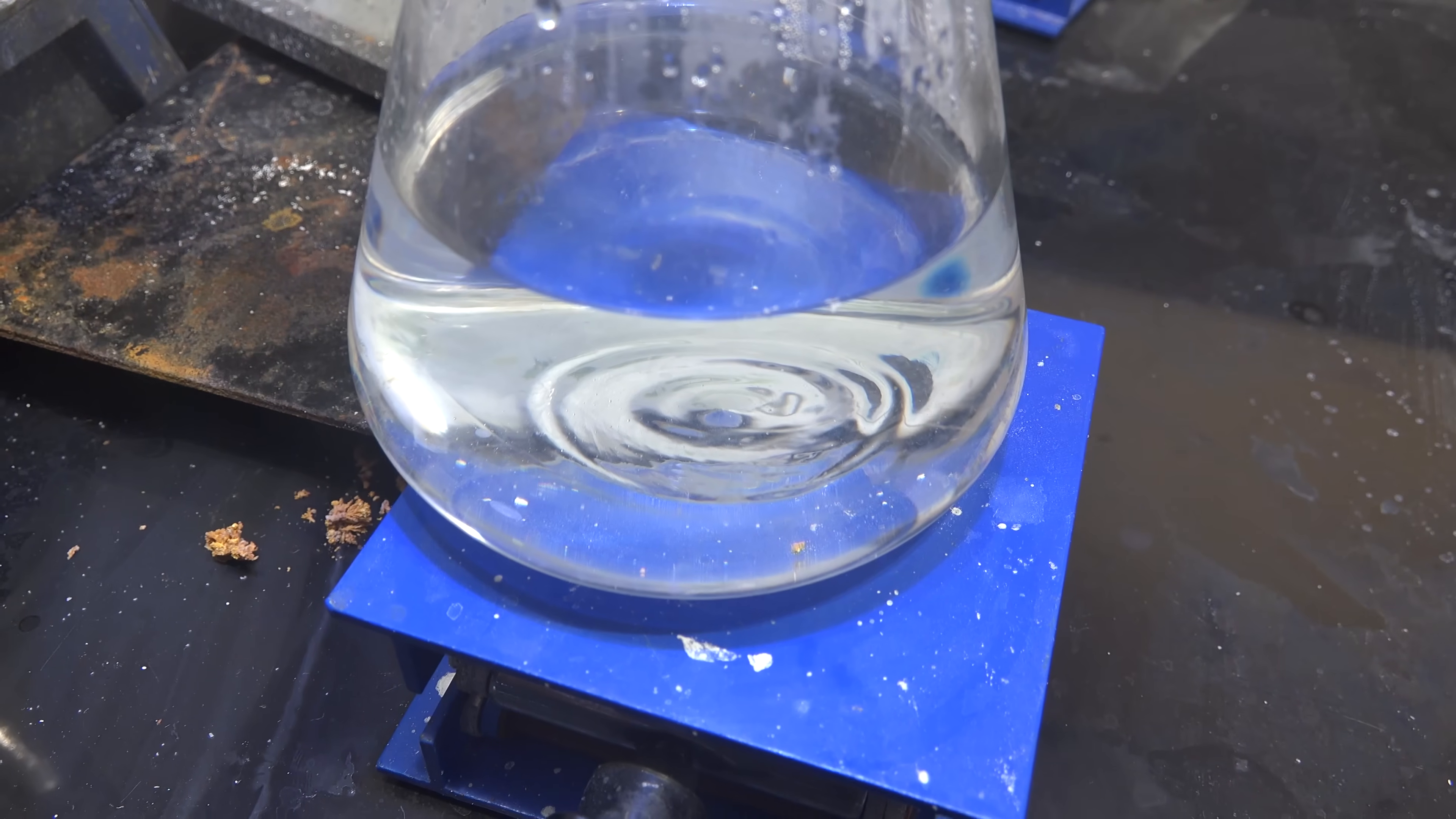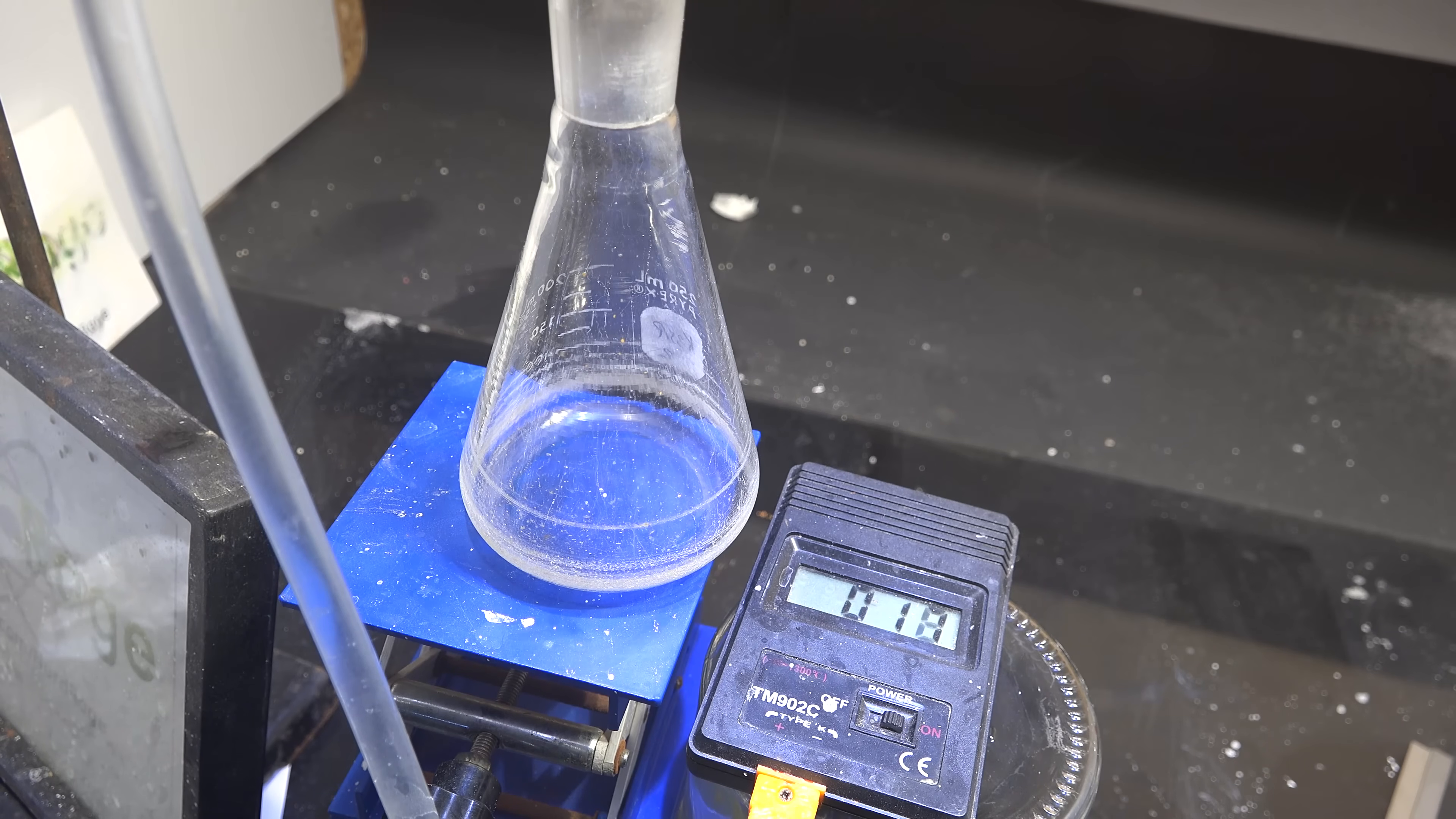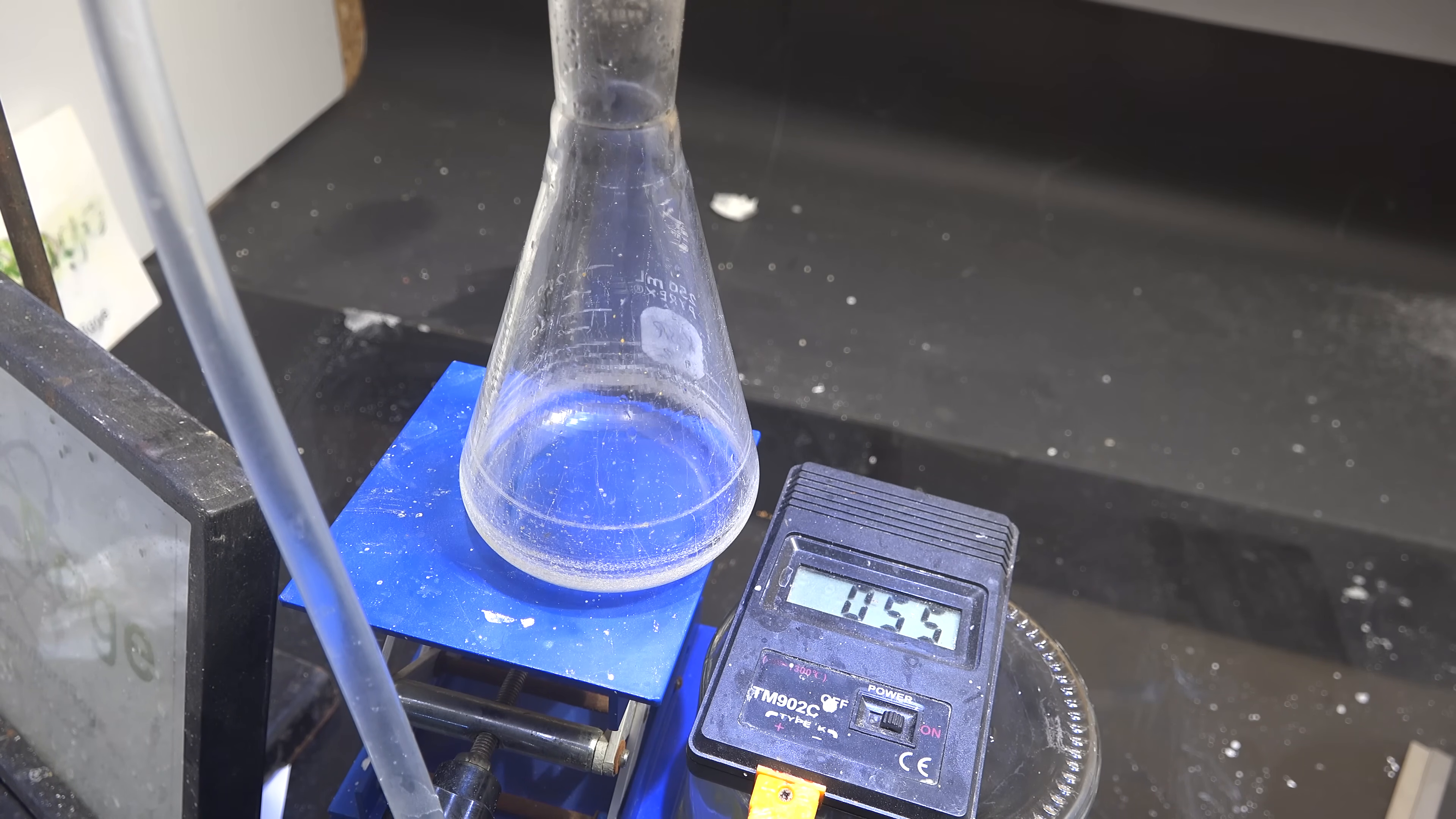To purify and concentrate it, we set up for fractional distillation and start distilling. If you kept the original reaction temperature in the right range, the first liquid you'll distill should be water.